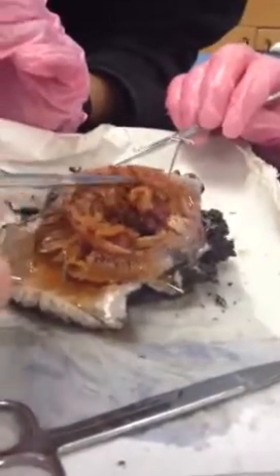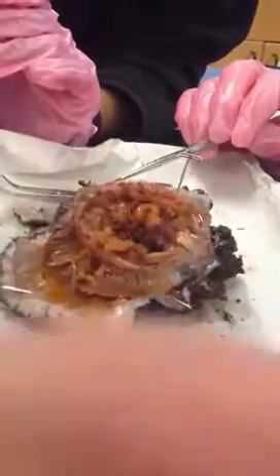So kind of like we saw, when did we have that before, like the squid? Yeah. Same kind of thing. So that's going to retract the tentacles into the pharynx. So the pharynx, here you see pharynx. Here's the retractor muscles. Okay, so that's what you're looking at here.